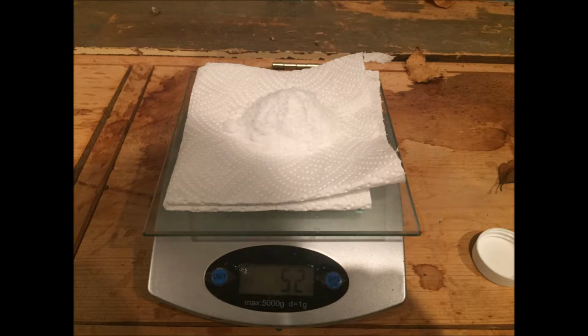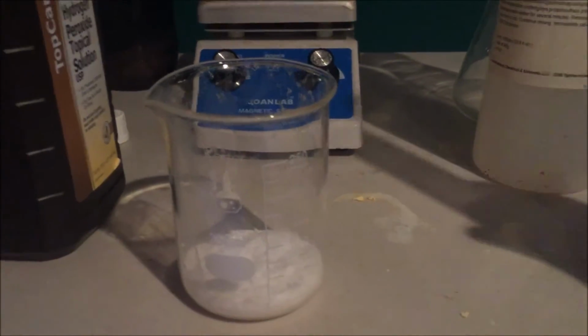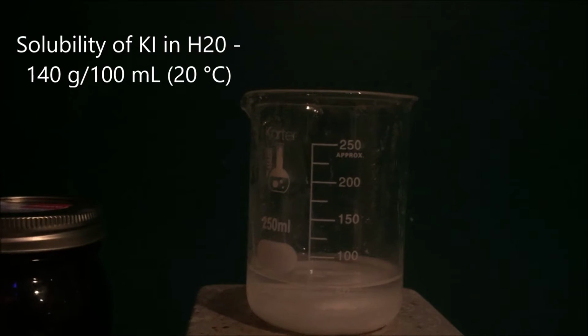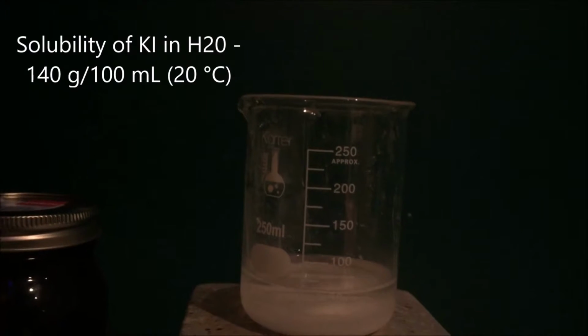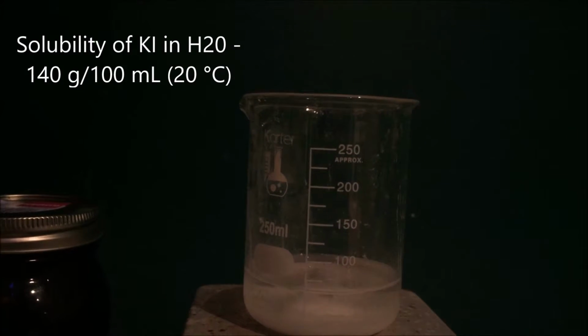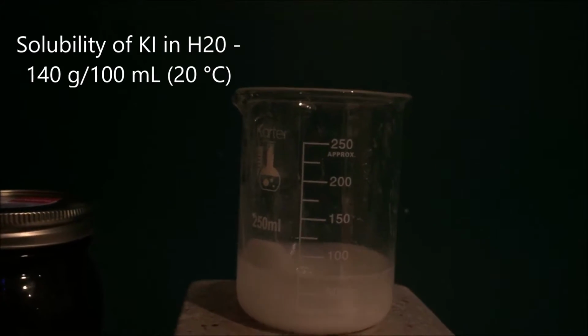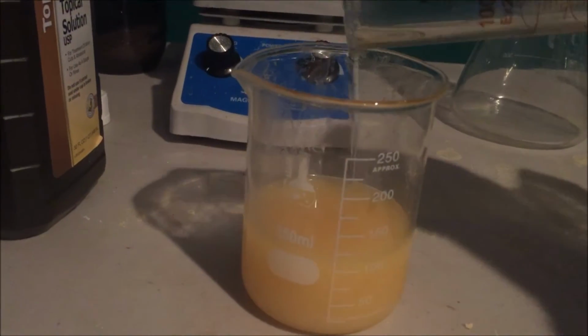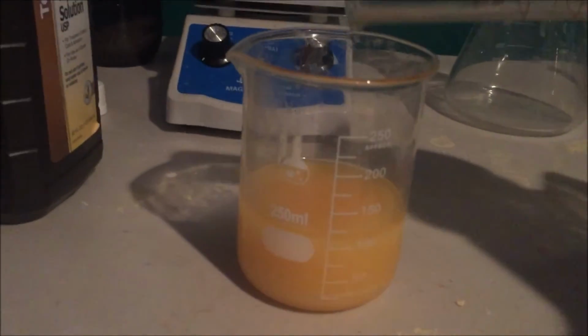First, I measured out about 50 grams of potassium iodide and transferred it into a beaker. Just enough water was then added to allow it to dissolve. I then added an equal volume of 30% hydrochloric acid to this solution.